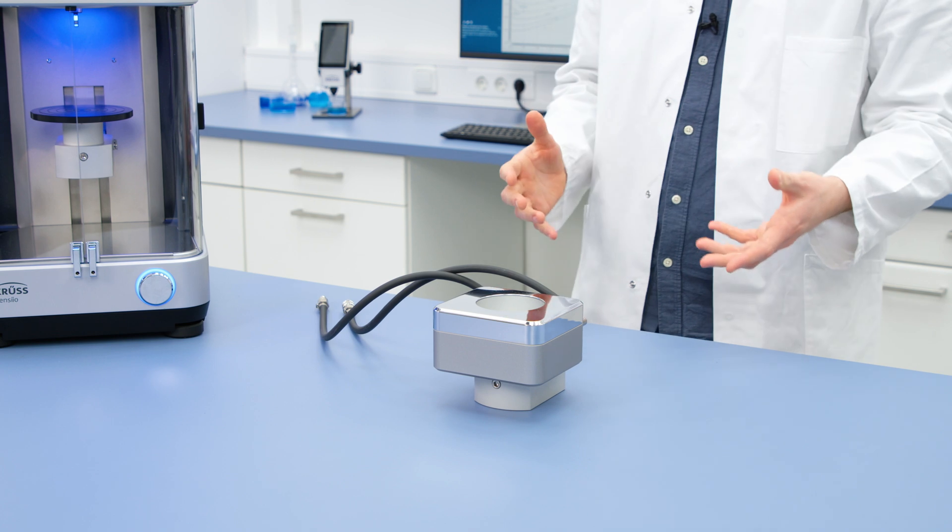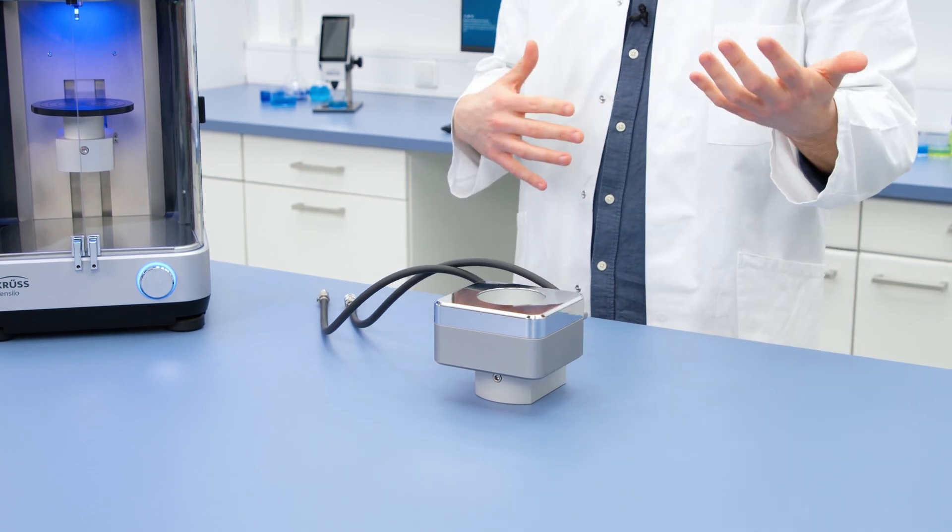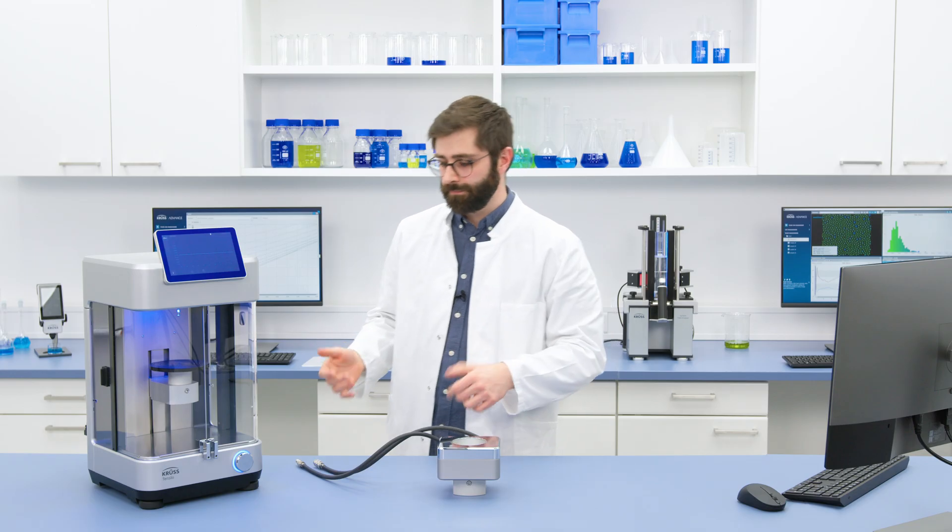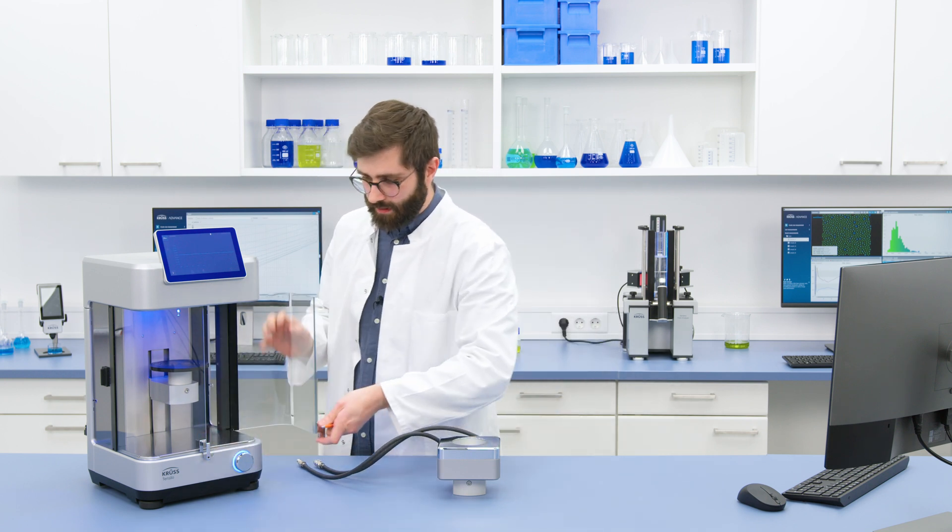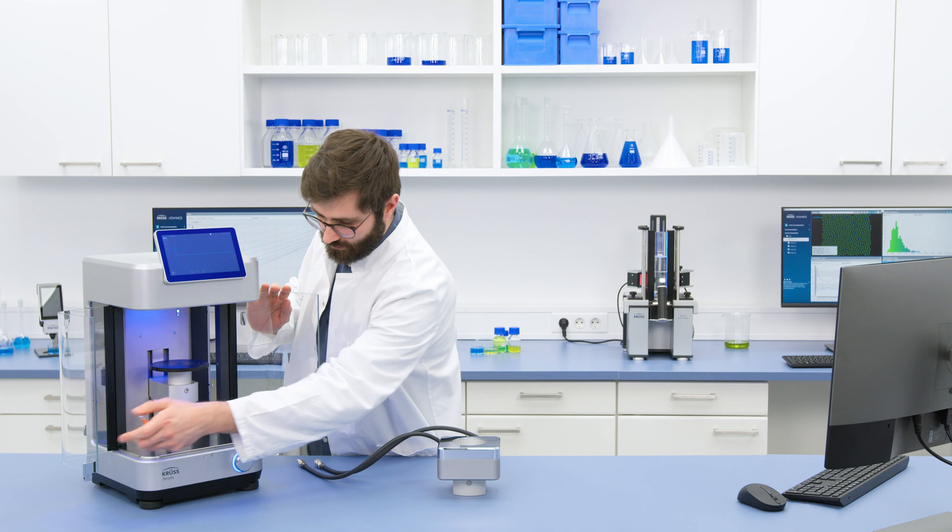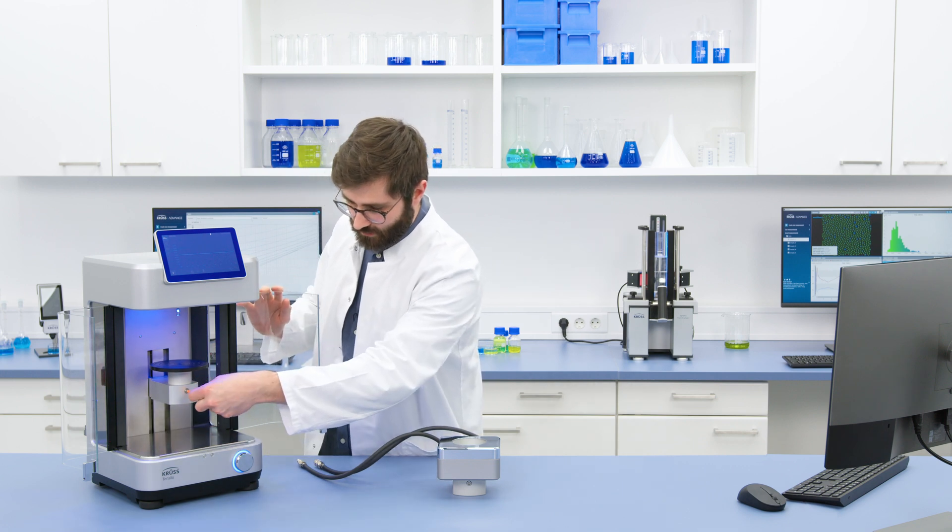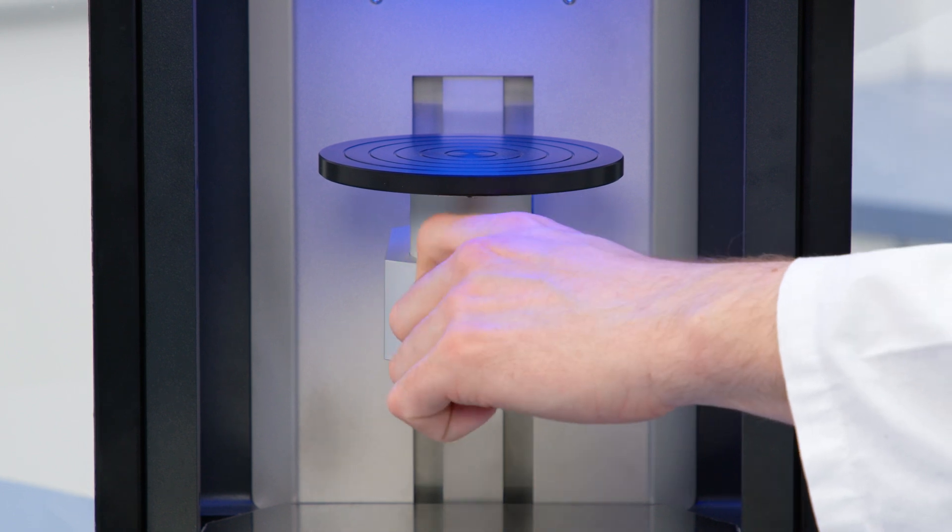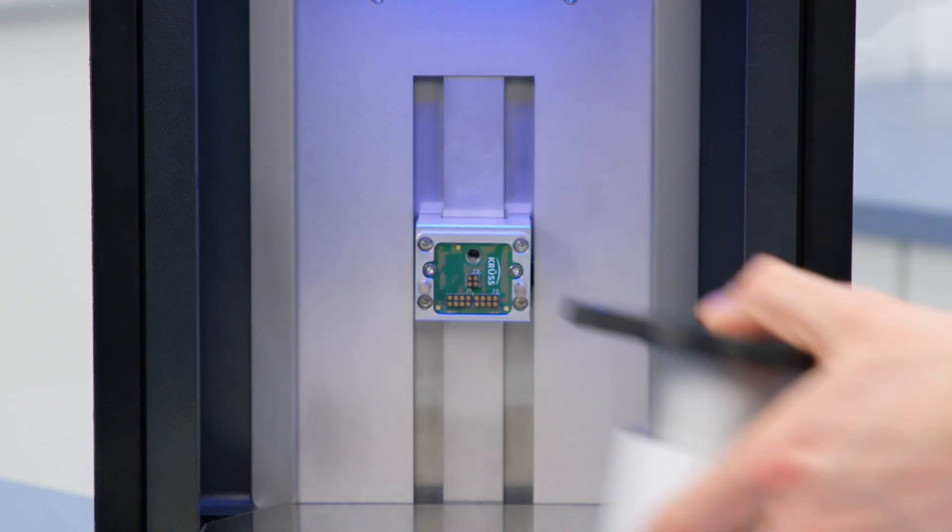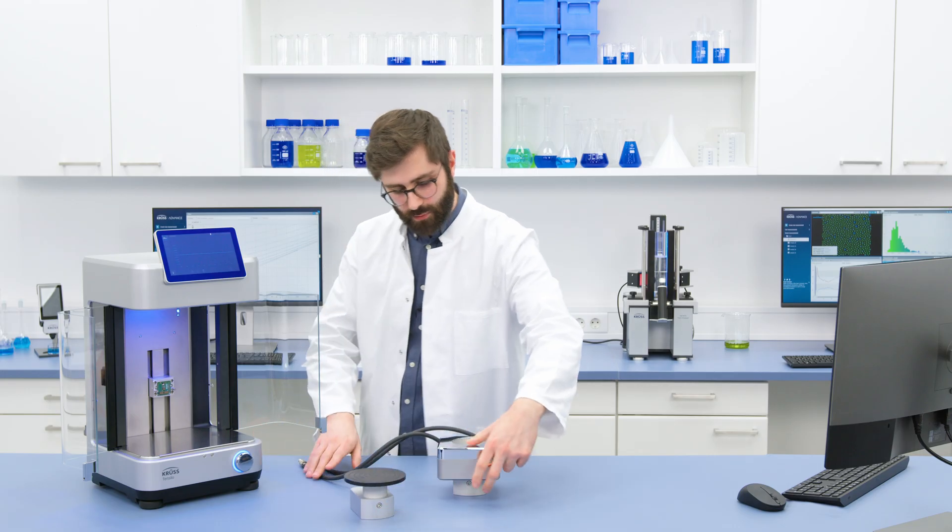And if I want to change this, I can take off the standard table here with just a single screw.